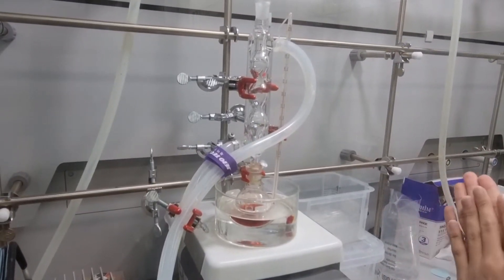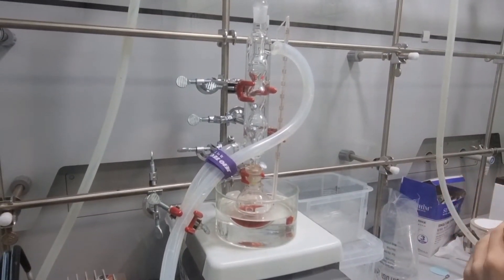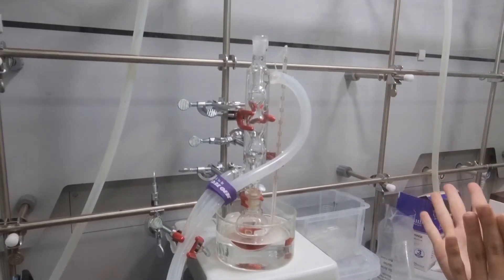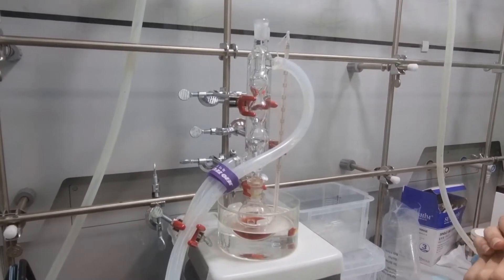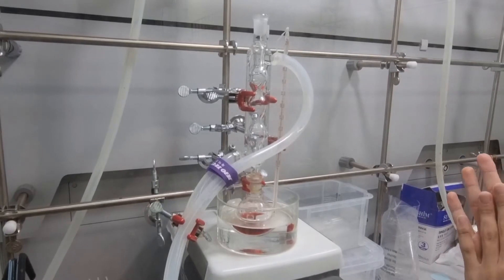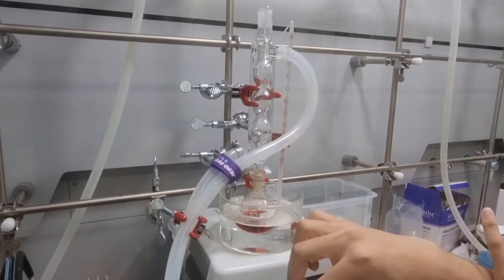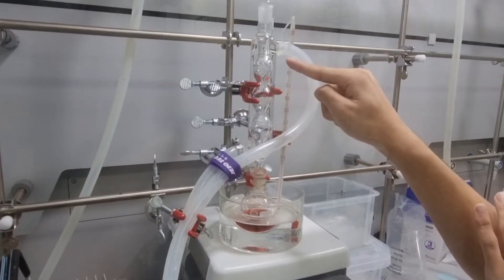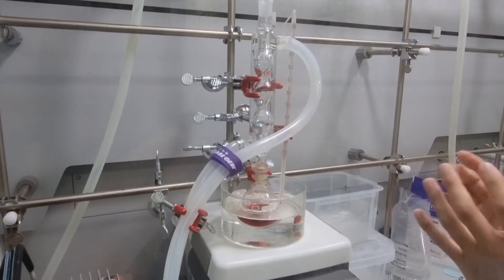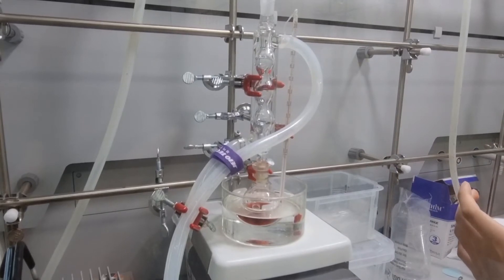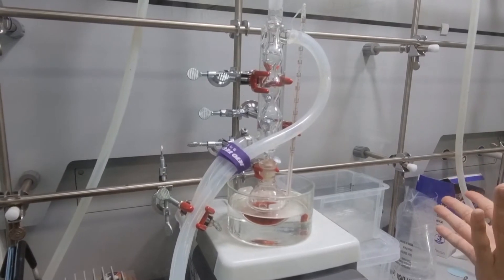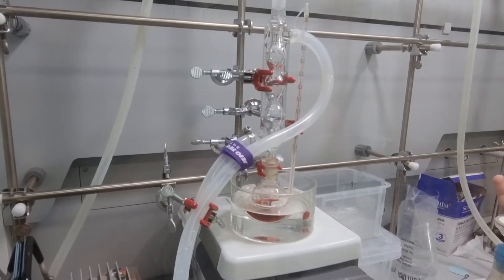So in the case of oil bath synthesis, you synthesize it in a reflux condition. When you stir it, you can see that the top part is wide open, right? So the solvent can evaporate or vaporize. In order to prevent that, you install this water column. And there's water out in the outer part of the layer of the column, so that this could turn back into liquid and then drop back. So this process, this condition is called the reflux condition.